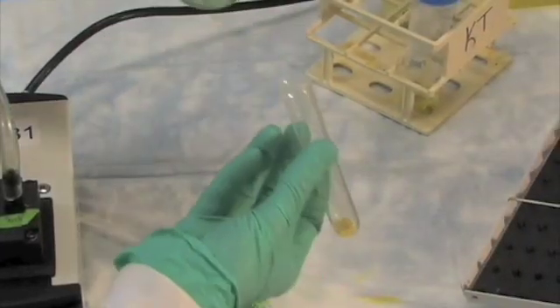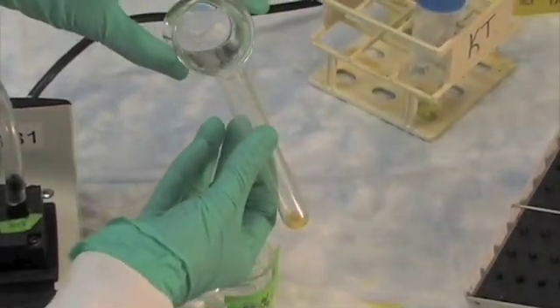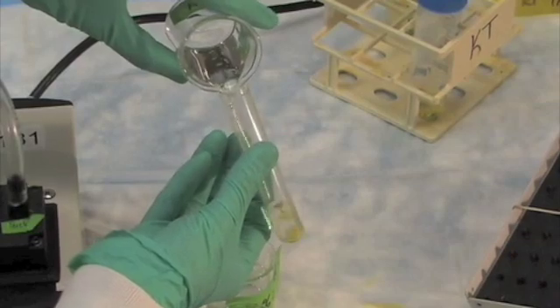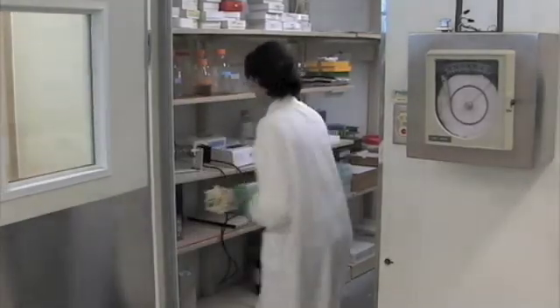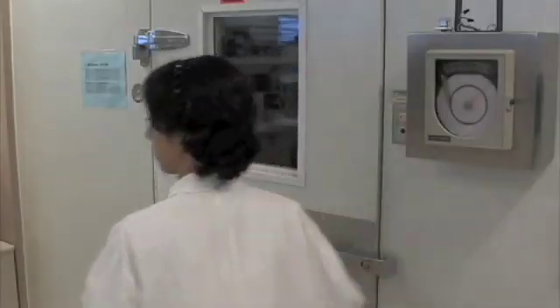Following the last wash in ethanol, samples are placed in a fresh 70% ethanol, and may be stored at 4 degrees Celsius until further processing. A few advantages of paraffin embedding over using frozen tissues is that tissue integrity is superior, and samples can be stored for long periods of time.